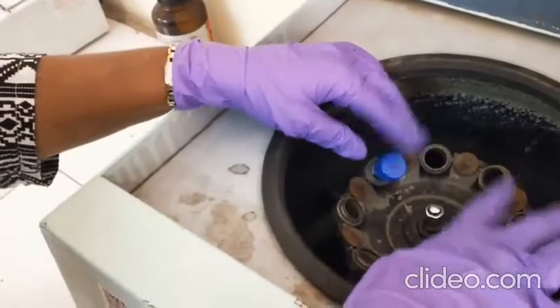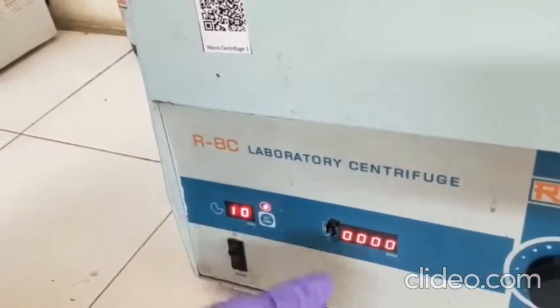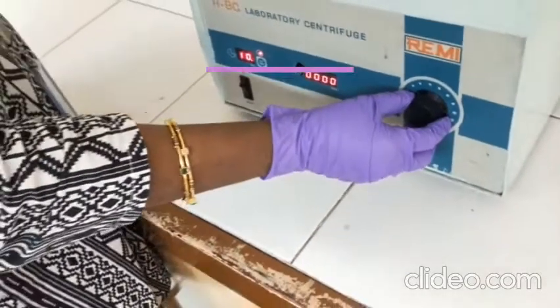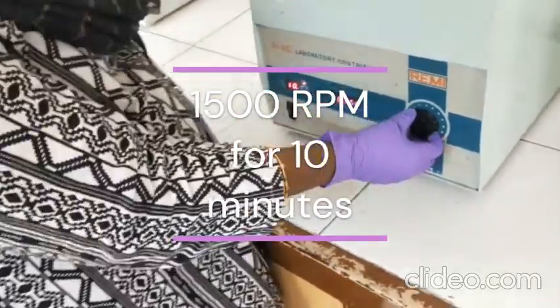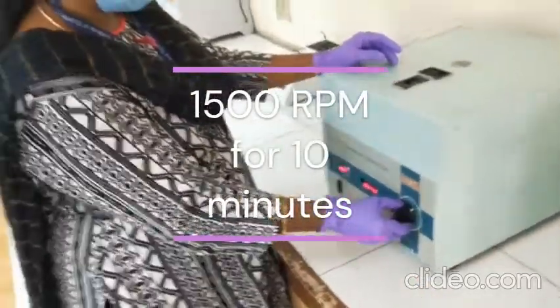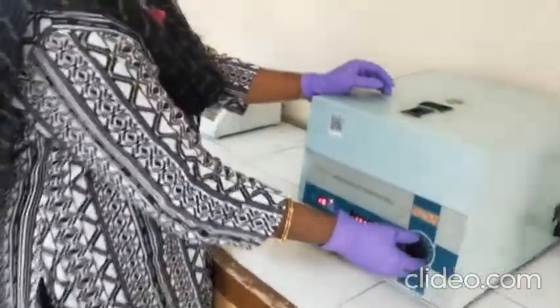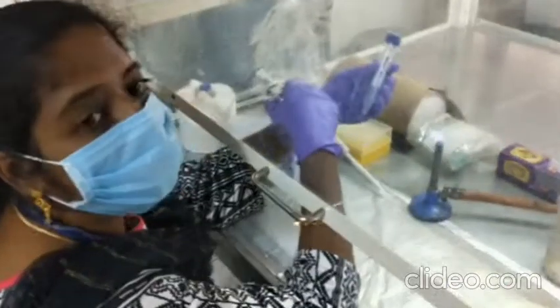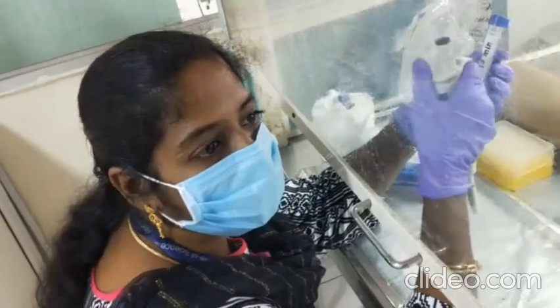The tubes are placed in the centrifuge and the timer is set for 10 minutes. We increase the RPM step by step. After centrifugation, we discard the supernatant and add PBS to the pellet to resuspend it.